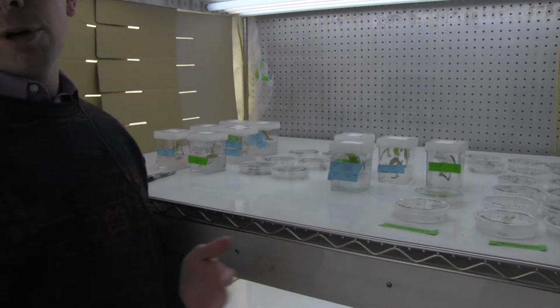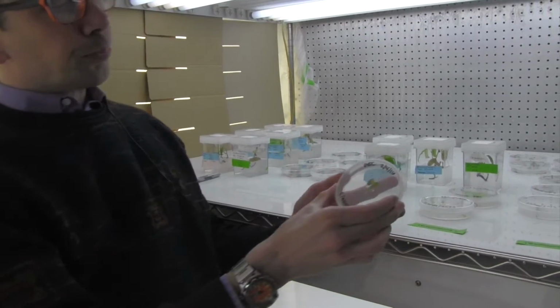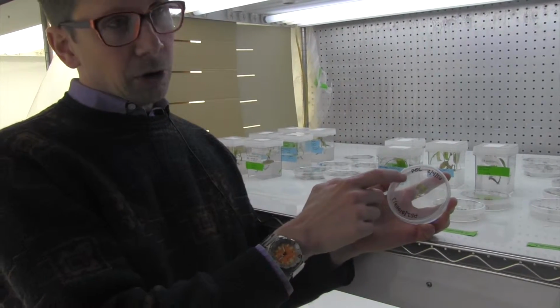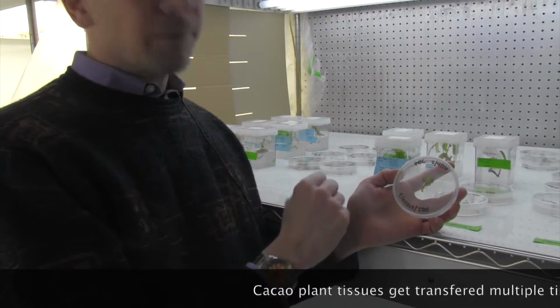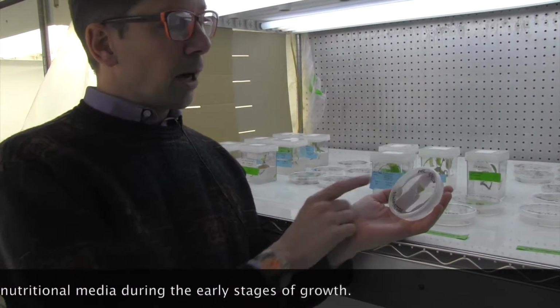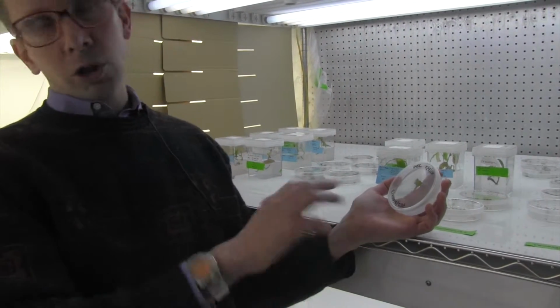So after the embryos begin to develop and they elongate and they have a primary root structure, we transfer them, this is a good example, to a different kind of medium, and they continue to grow. The same material that comes from the previous plates, exactly. So how old is this one here? This one was from the same batch. This probably is about 10 weeks old at the moment. Okay. Could be a little bit older, could be a little bit younger.